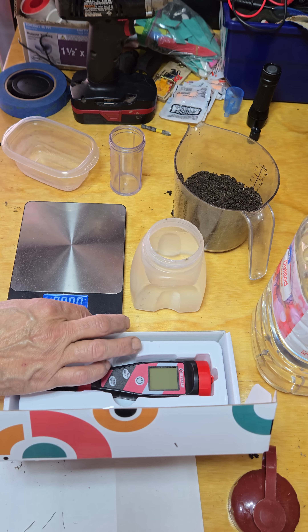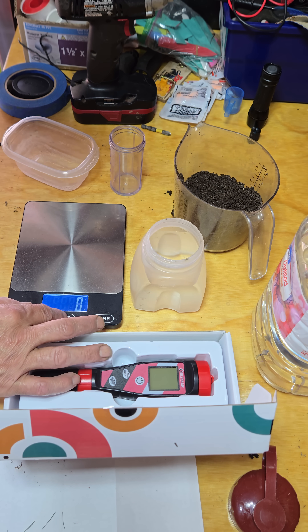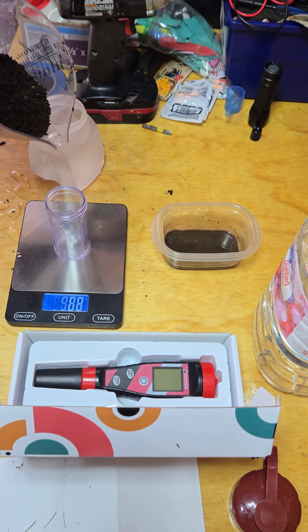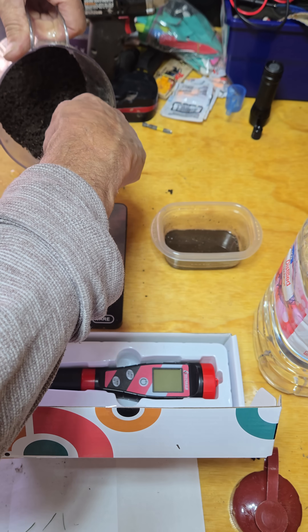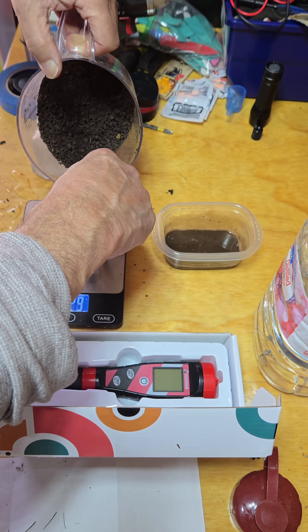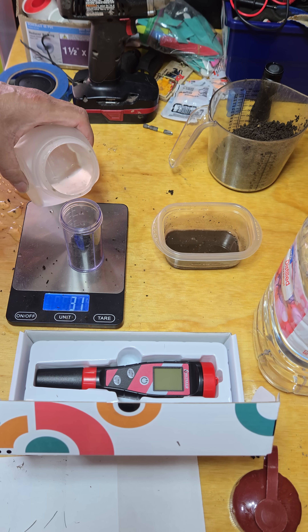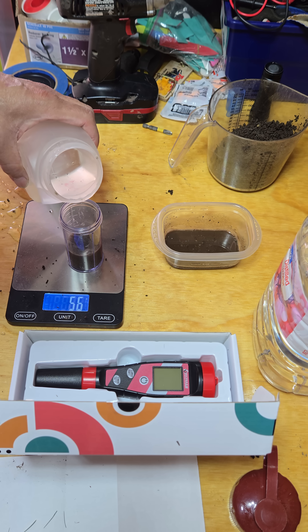I just poured distilled water into that cup there to rinse off my probe after testing. I'm setting my scale to grams, zeroing it out, and measuring out 30 grams of soil. Then I'm going to use fresh clean distilled water and measure out 30 grams of water.